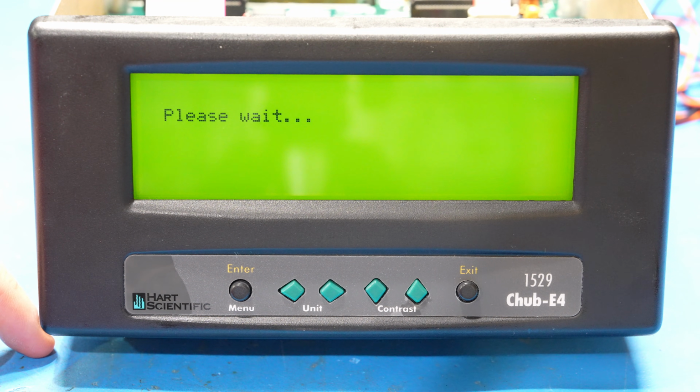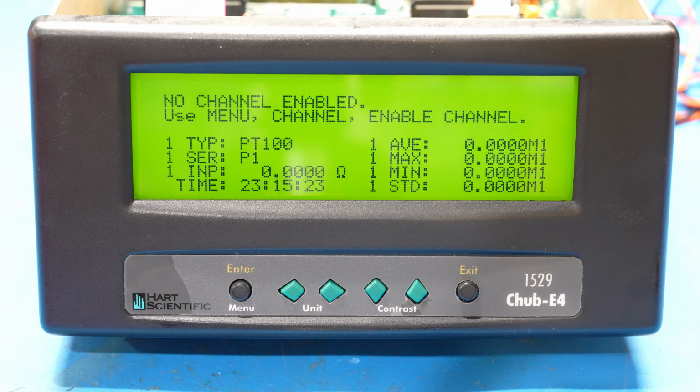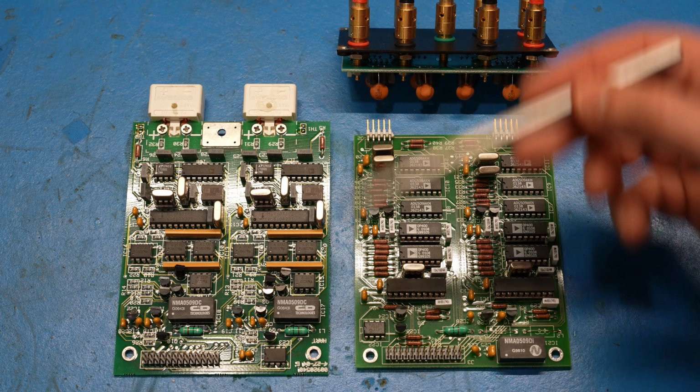If I press enter to continue, it sometimes throws an error, but I guess it was some memory corruption, and that seems to have been cleared. There you go. So it does boot, and we'll play with it in a second. But let me show you what the actual problem still remains. And here's our faulty module.